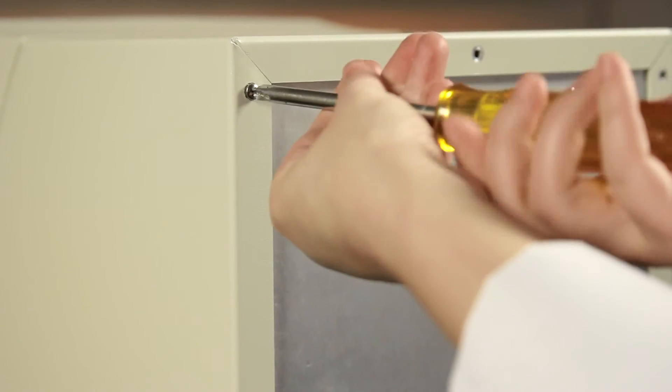Finally, slide the cover back onto the instrument and replace the screws. Once the cover is on and all of the screws have been replaced, you can reconnect the power and your GelDoc EZ is ready to go.